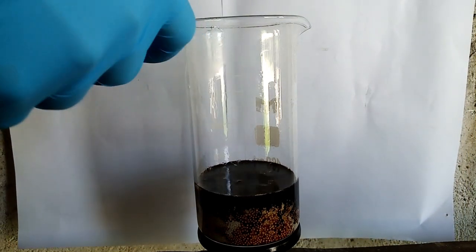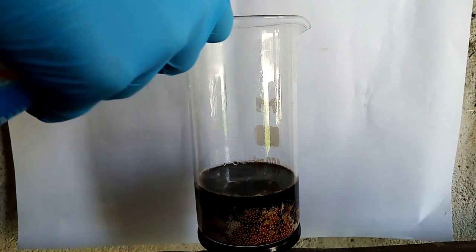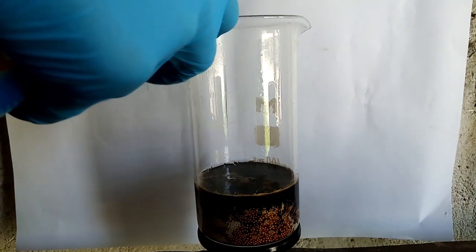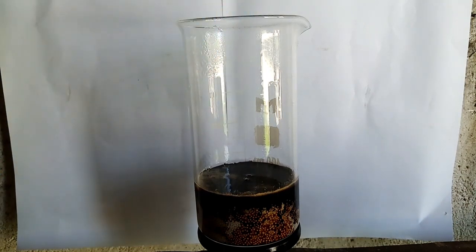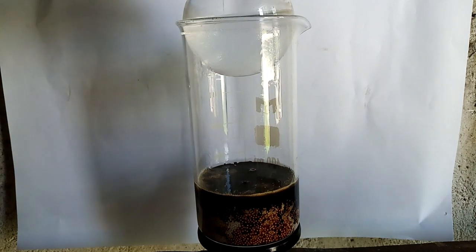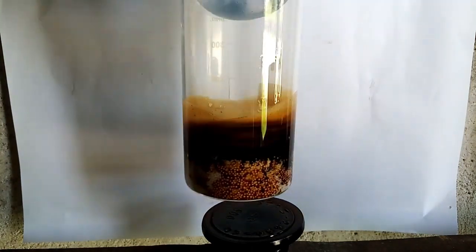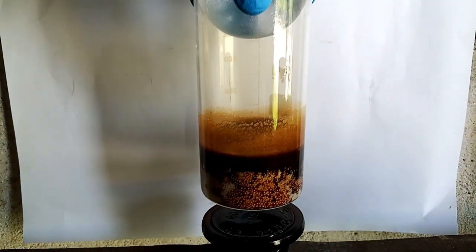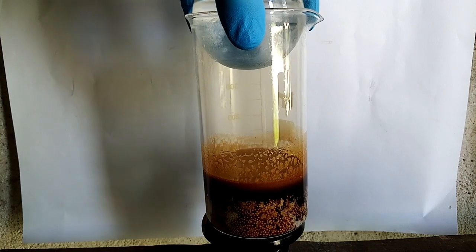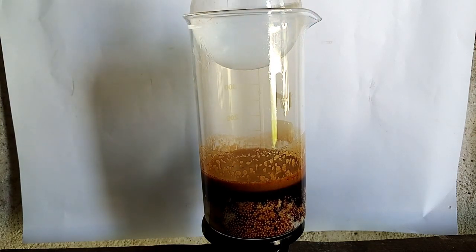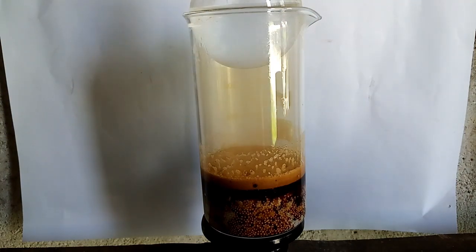Occasionally I spray out with some water but I have no reason why I'm doing this. After some time we will see how the reaction is going. I let the reaction sit for the day.